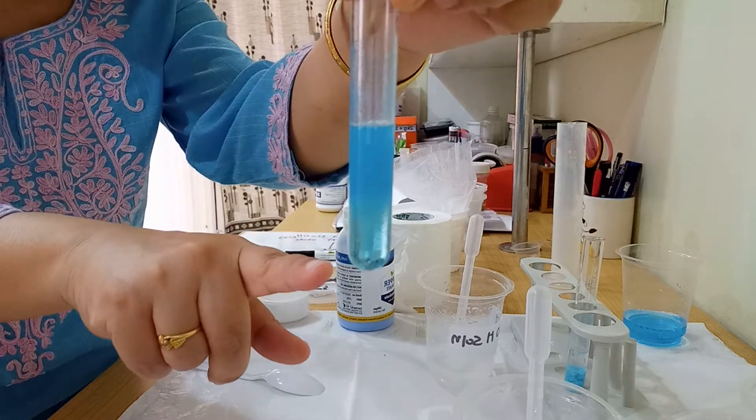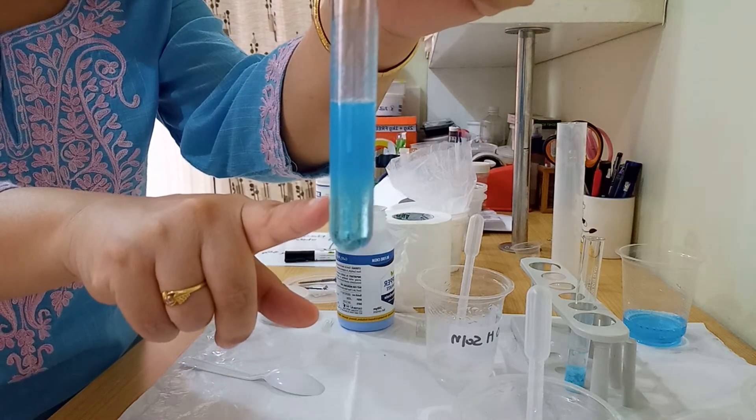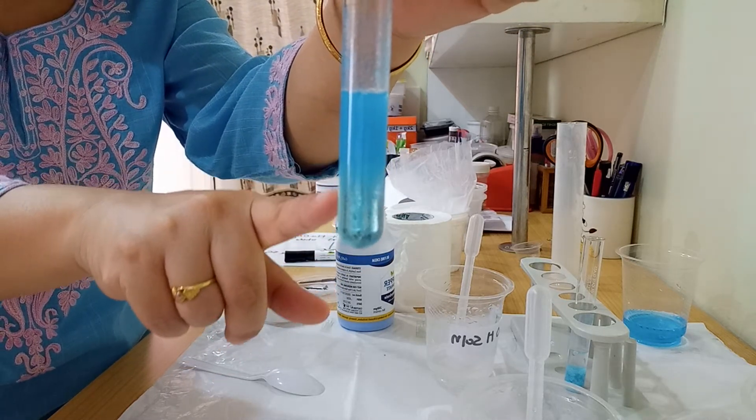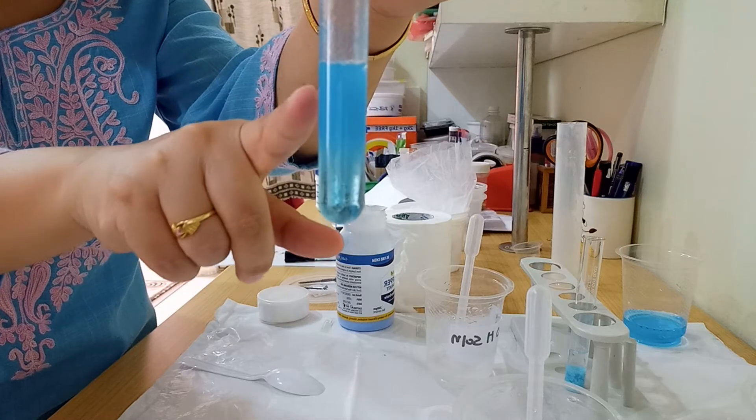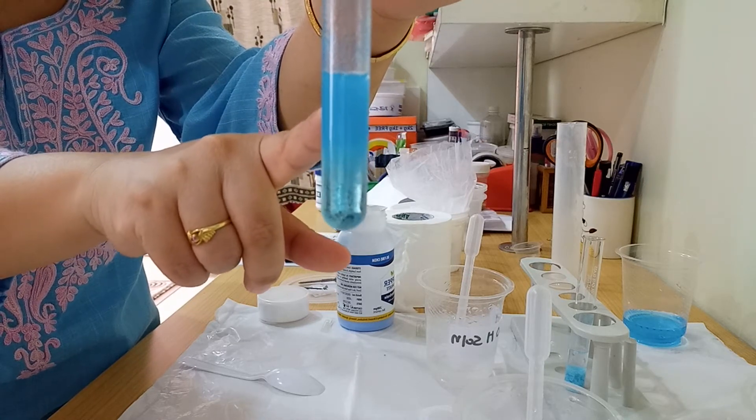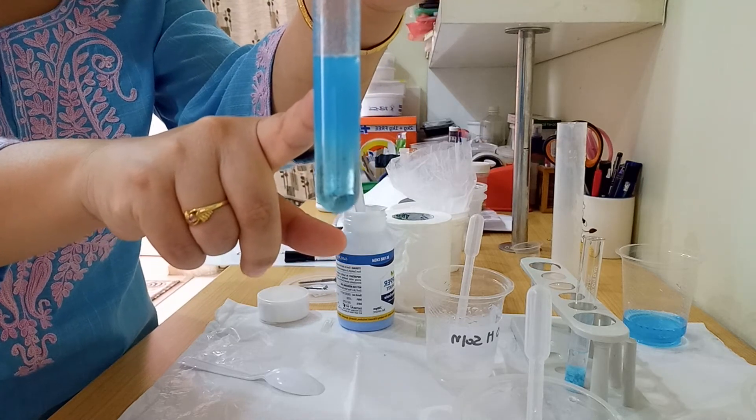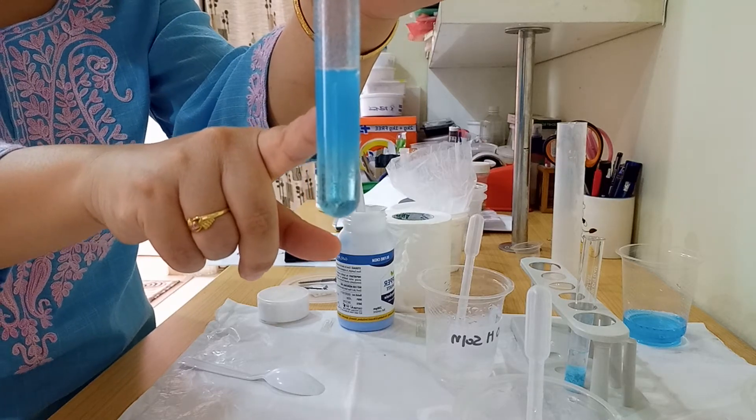Initially it was a transparent blue solution. Now it's no longer transparent. At the top of the test tube you can see precipitate forming. It has a whitish-blue color.